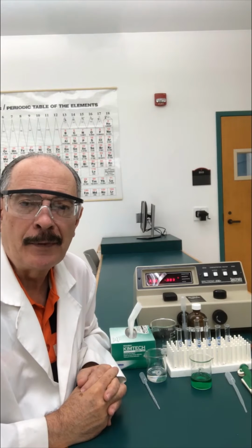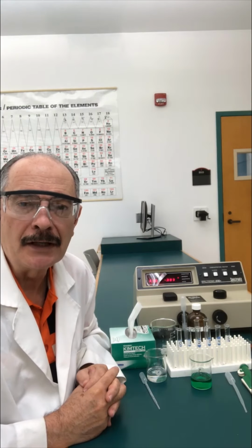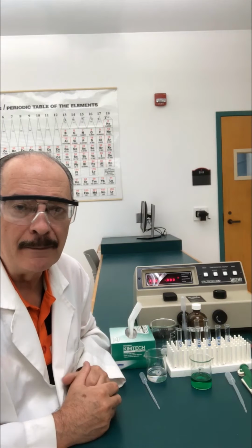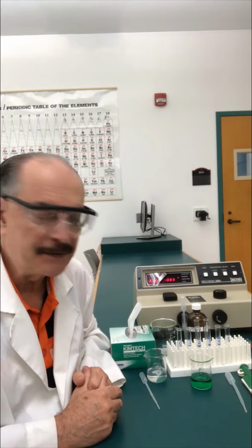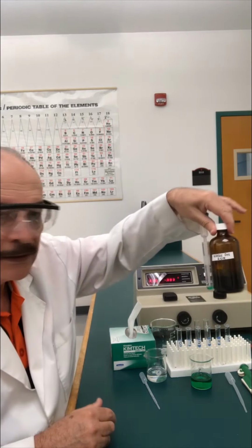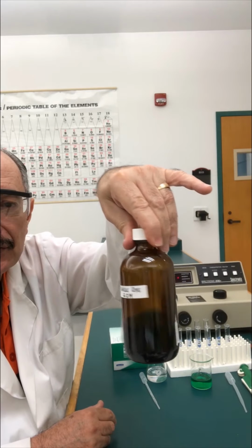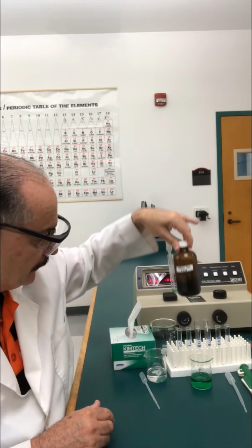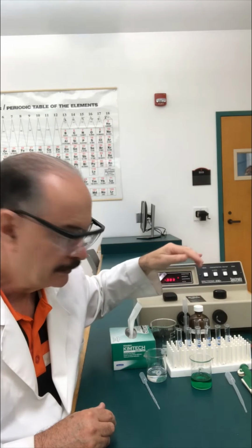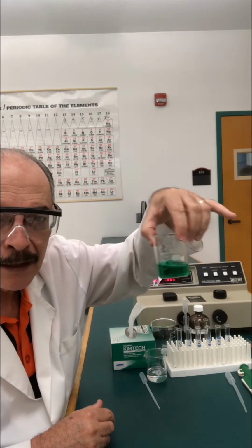Okay, students, this is part C of our spectroscopy activity. As you can see, I've relocated here to the bench where the spectrometer is. In part A, we took a stock concentrated solution of this compound viridis and made a 0.200 molar solution. This is our test solution.